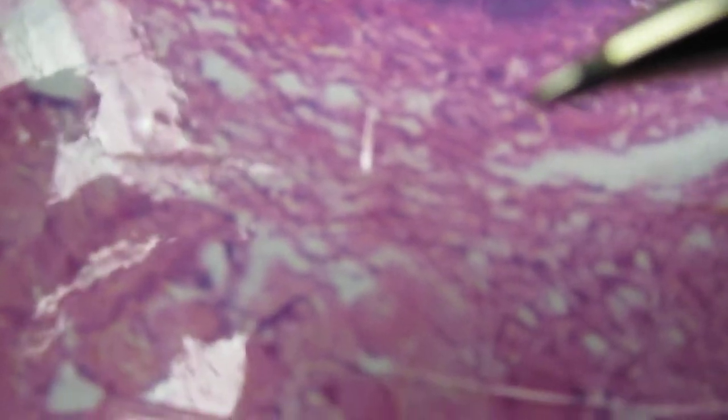It's kind of nice to go down here and to actually see some of the connective tissues that underlie this tissue. So we have a combination of dense regular and dense irregular connective tissues, or rather dense irregular and areolar, dense irregular and areolar. And we actually get to see some skeletal muscle right here. Okay, because that's what we use for swallowing.